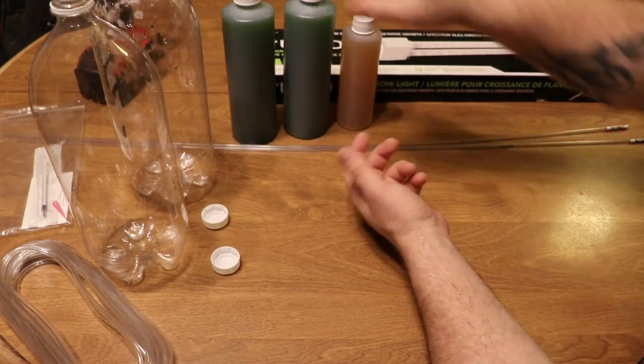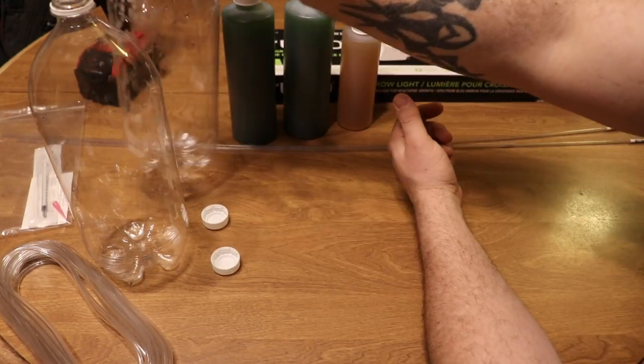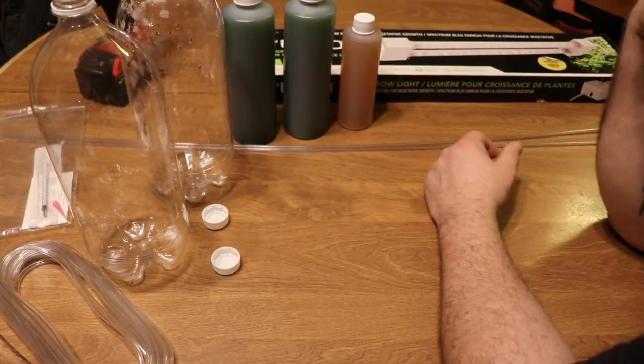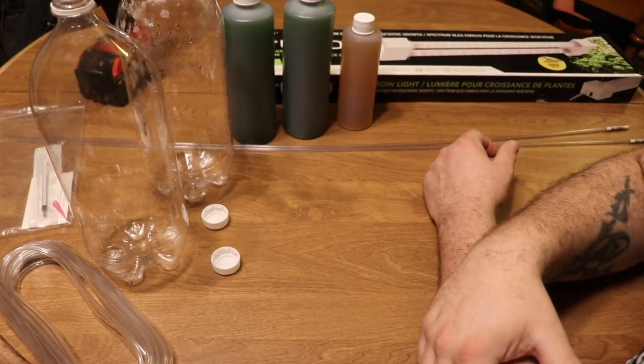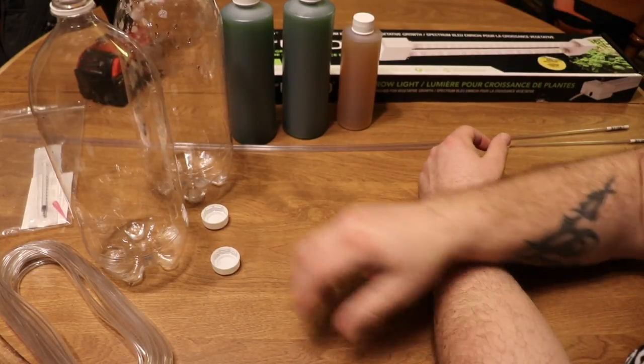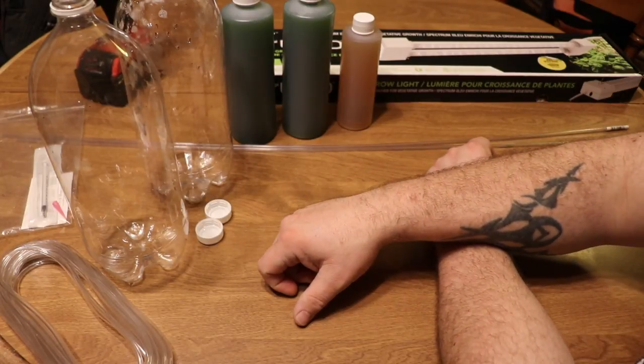The biggest thing about culturing is keeping it sterile. Alcohol is going to help a lot. Currently I don't have any, which is a bit of a problem with the current times—people are getting kind of crazy about stockpiling even in my part of the world, so alcohol is not readily available and I don't have any on hand.